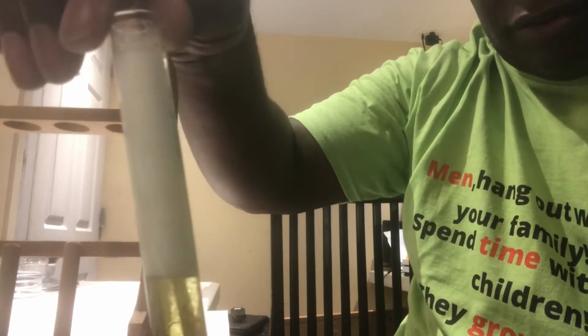Okay, so once again, what are the factors that affect our rates of reactions? Temperature, concentration, surface area, pressure for gas, and catalyst. Also ionic versus covalent. Ionic beats covalent. Okay, alrighty. So here we go, folks. Pressure, we can talk about in a second.